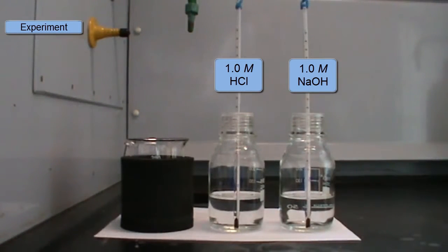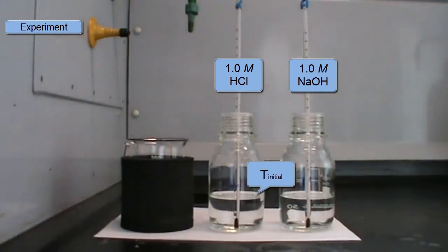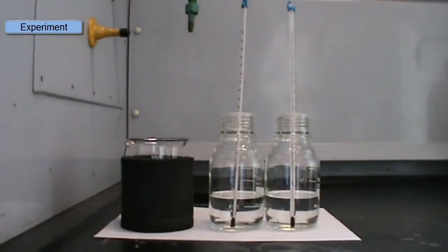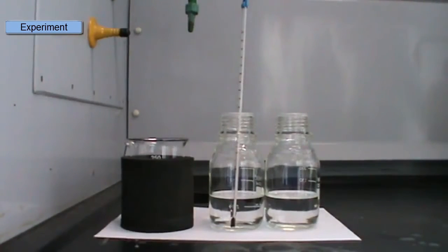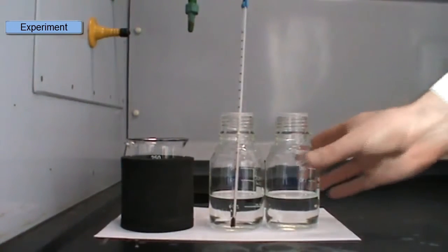Okay, so let's go on now to the experiment itself. So here I have my acid and base that I'm going to mix. They should both be at the same temperature. We need to check that, and that temperature will be the initial temperature, T initial. I'll pour one solution into the calorimeter. So here I'm going to pour the base into the calorimeter.